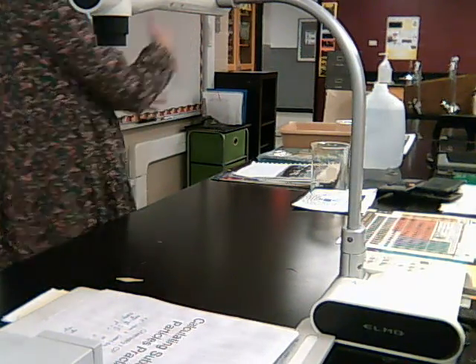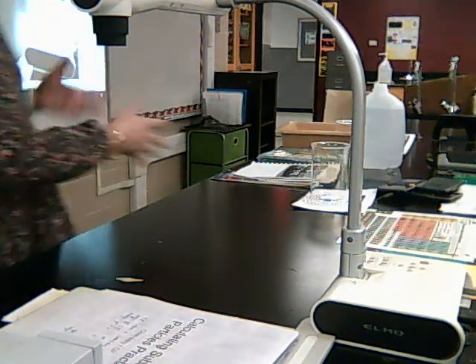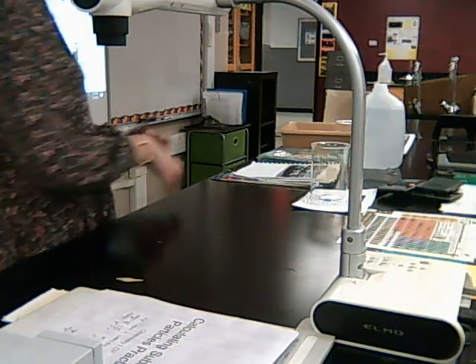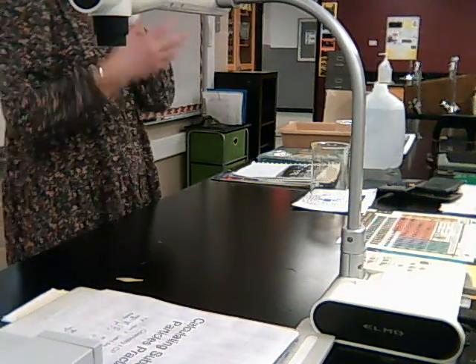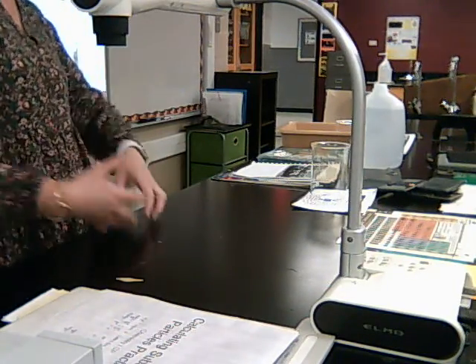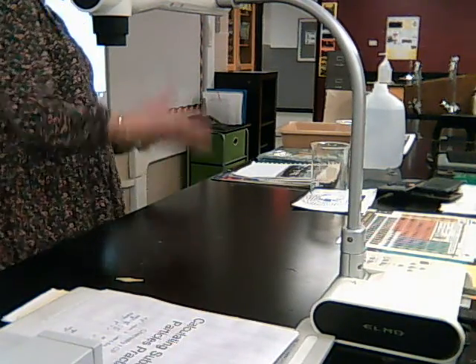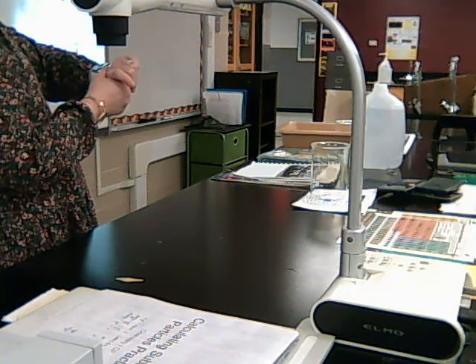Think it's going to make it go faster? What about you, Bridget? Faster. Okay, so that can be our prediction as to what we think the answer is going to be. When we cut the Alka-Seltzer into smaller pieces, we're going to increase the surface area, and we think that's going to make the reaction happen faster. Now, we'll do the experiment to see if that's correct or not. Any questions?